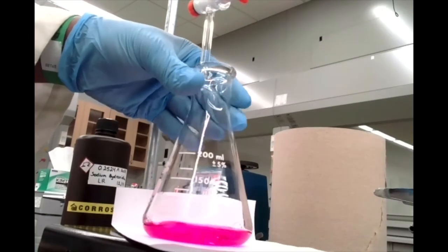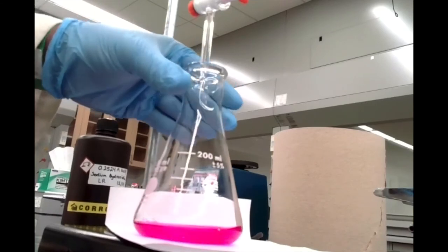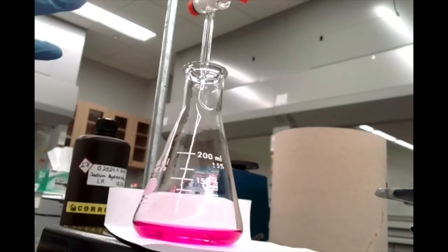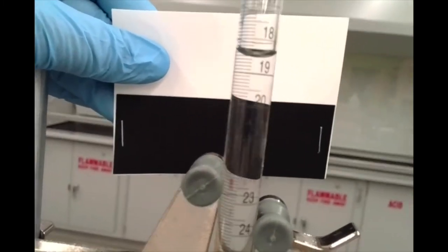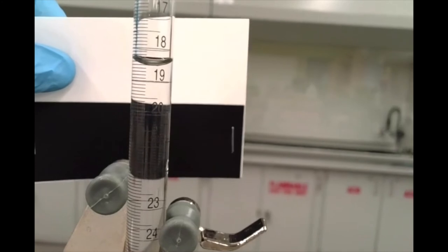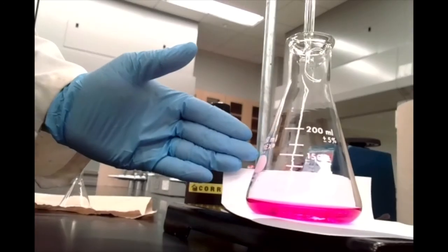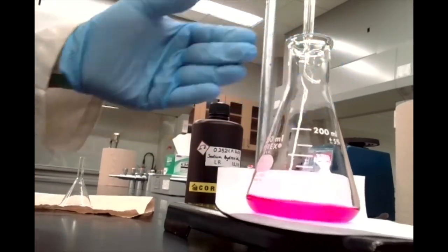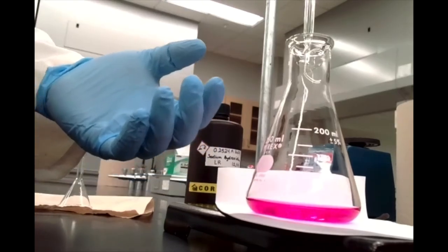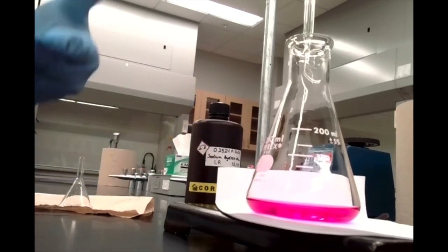There we go — you can see now that pink color is not disappearing no matter how much I swirl. I've clearly passed the endpoint. Let's make a note of our final volume. As I mentioned, we've overshot the endpoint. I'm not sure exactly at what drop the pink color first showed up, since we didn't know where the endpoint was. But now we know roughly where that endpoint is going to show up for our second and third trials.